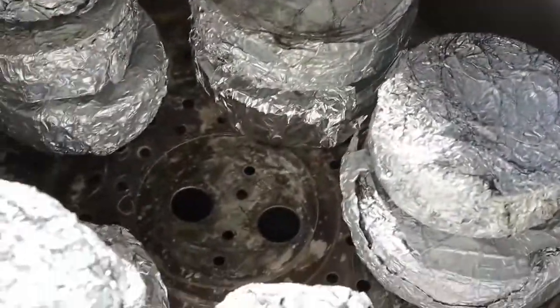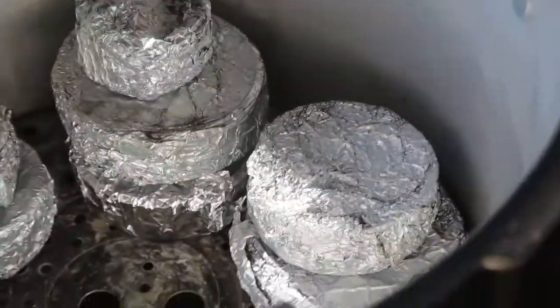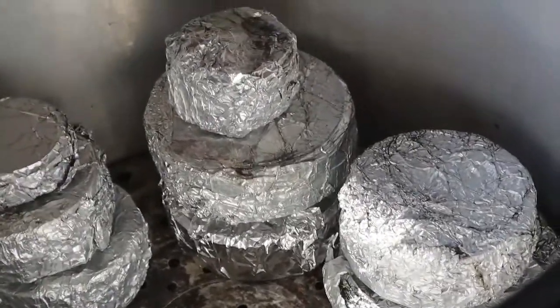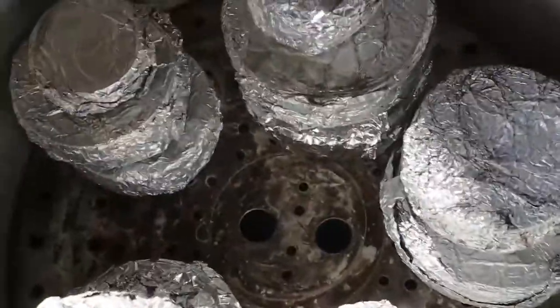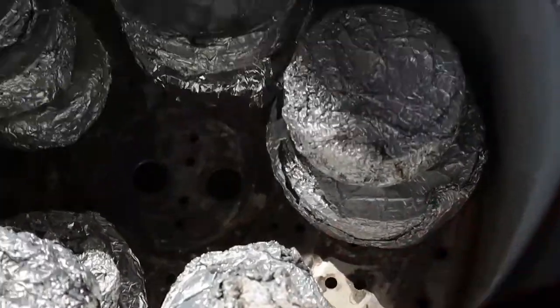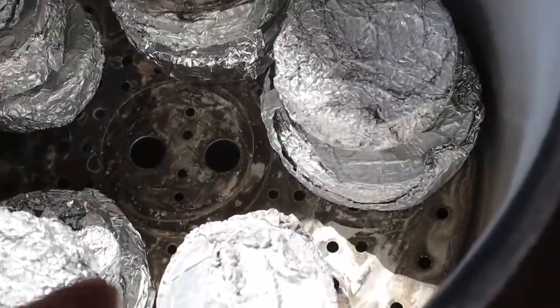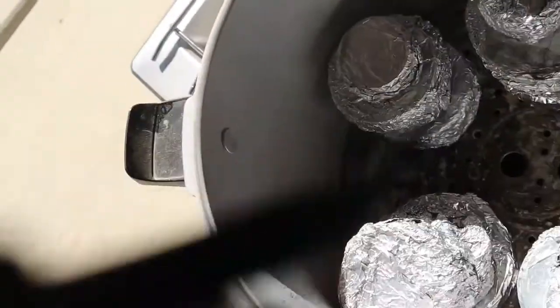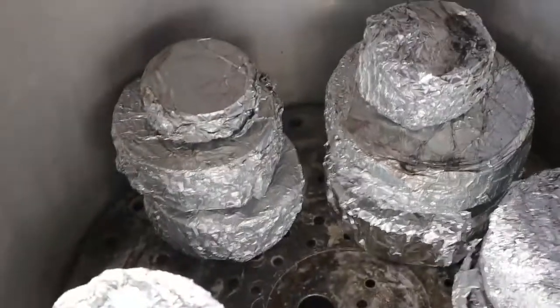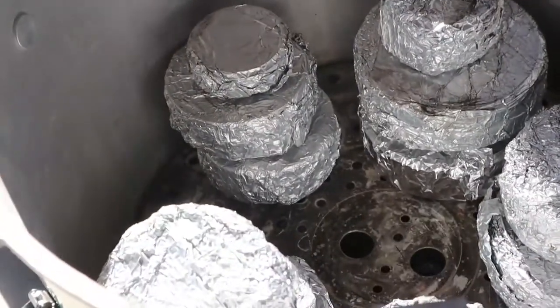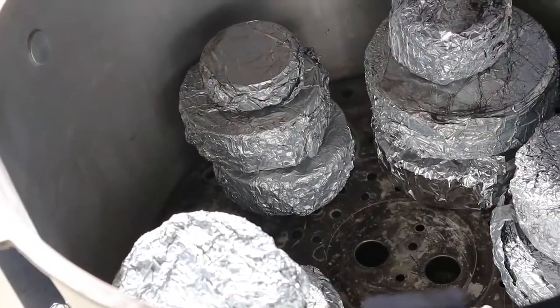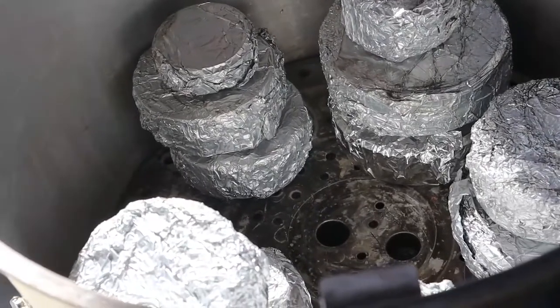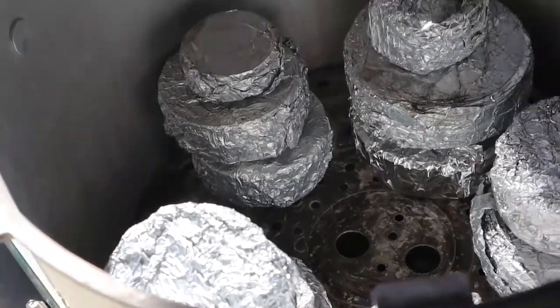Alright, so we're out here in the pressure cooker, wait, what I meant to say was that we got all the tin foil covered plates in the pressure cooker outside. Now I'm gonna go get some agar, I'm gonna put it right there in the middle. I usually keep them in this box, so I'm gonna keep this box in here. Alright guys, I'll be right back once the pressure sterilizing time is done, and you'll see me in front of my flow hood.